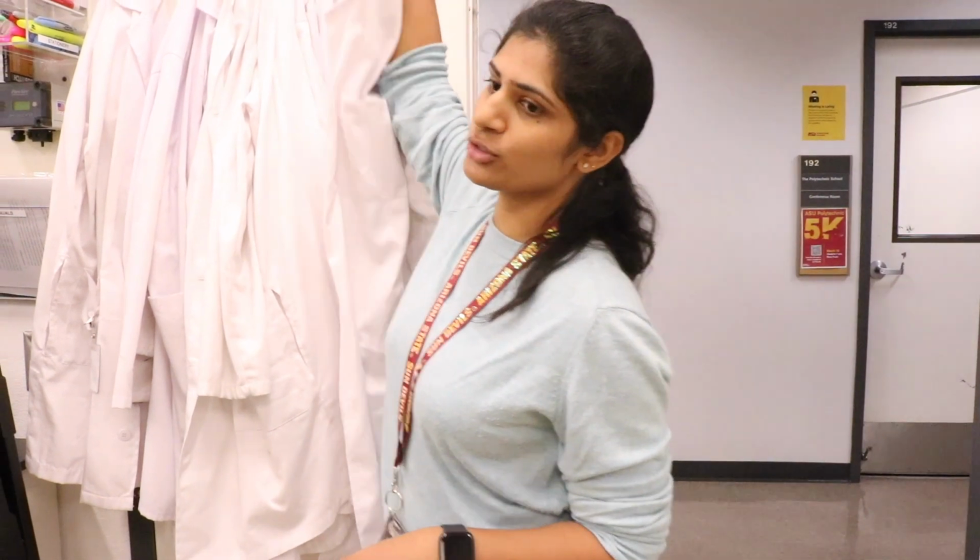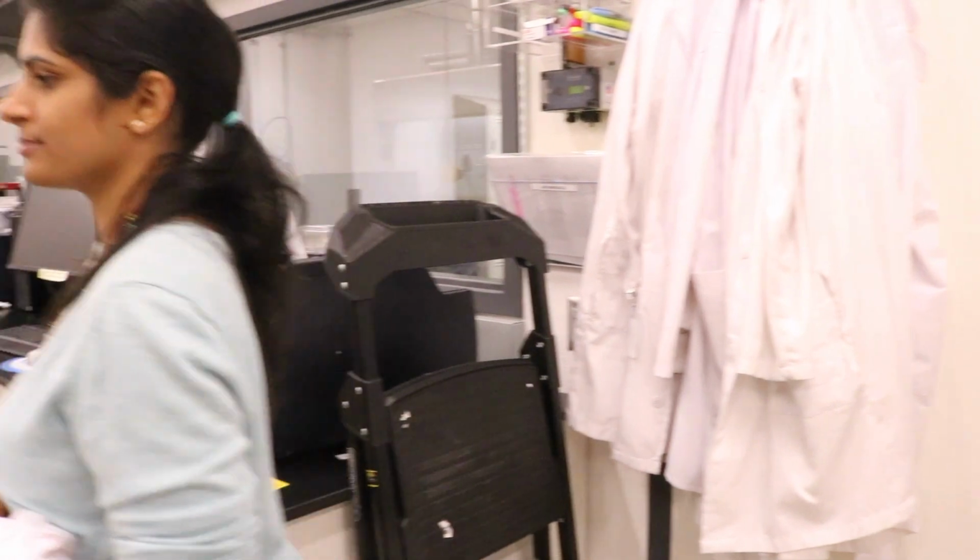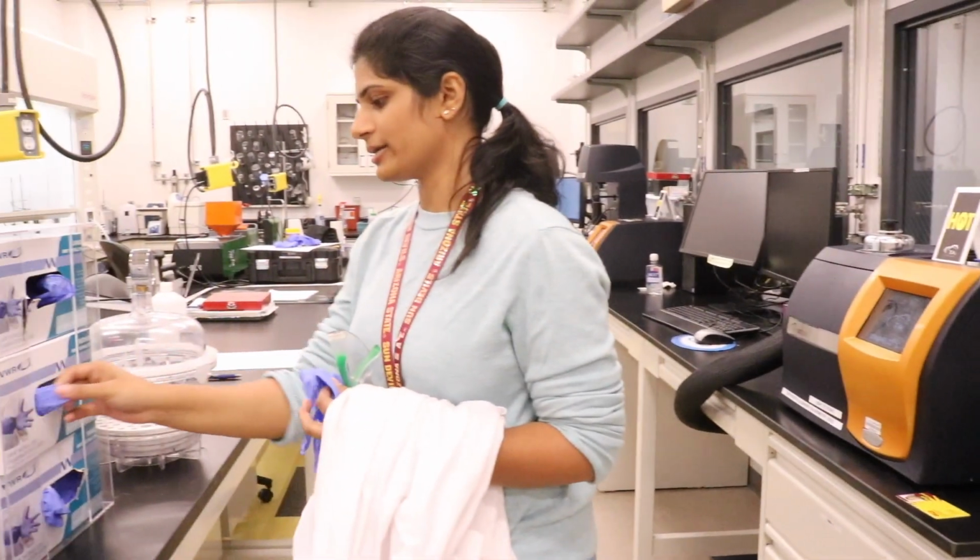In my hand, you can see a sensor, which is a volatile organic solvent sensor we 3D printed in our lab. Today, we'll show you the complete procedure of 3D printing a volatile organic solvent sensor, which detects different types of organic solvents. The first thing we do as soon as we enter the lab is to take our lab coat, safety goggles, and a pair of gloves of our size.